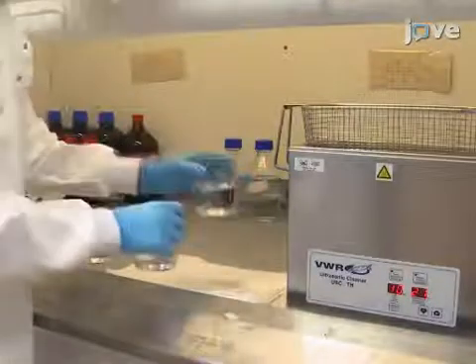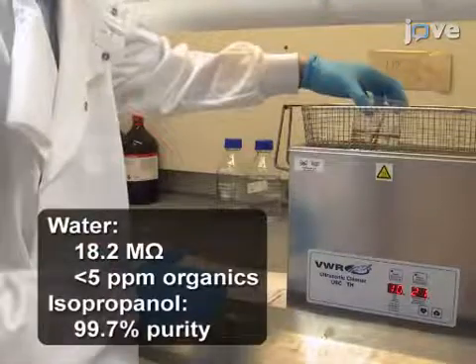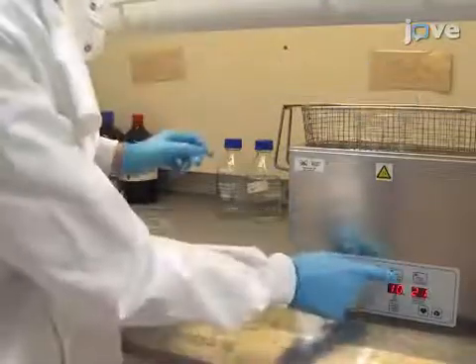Bath sonicate the instruments and the discs supporting the substrate in ultra-pure water, followed by isopropanol and again ultra-pure water, each for 10 minutes.